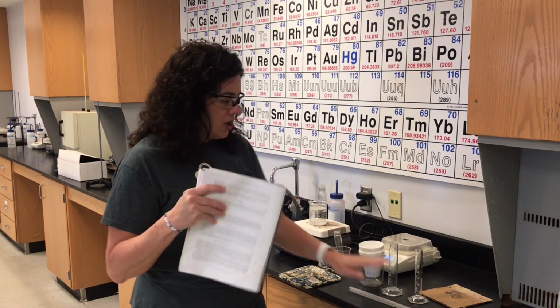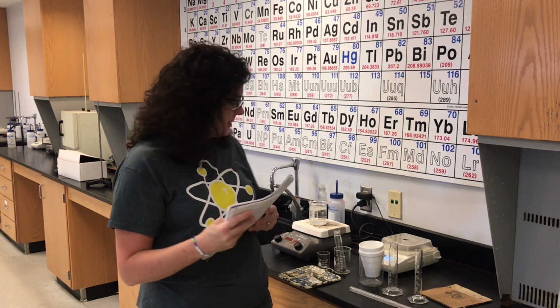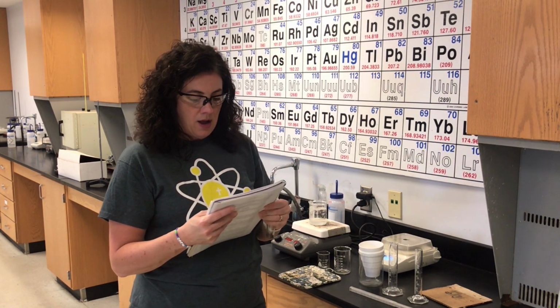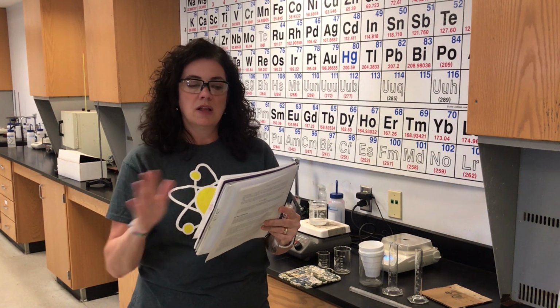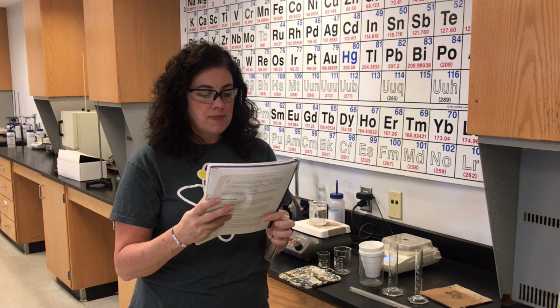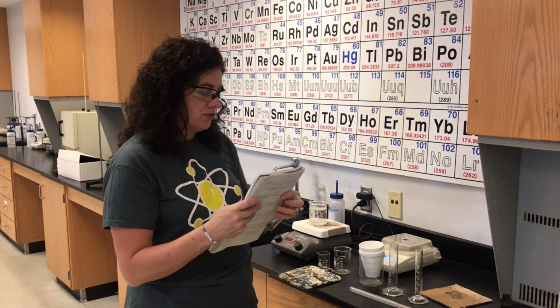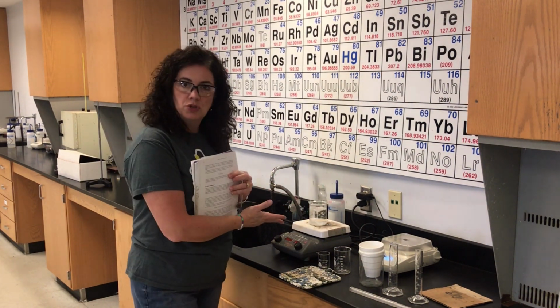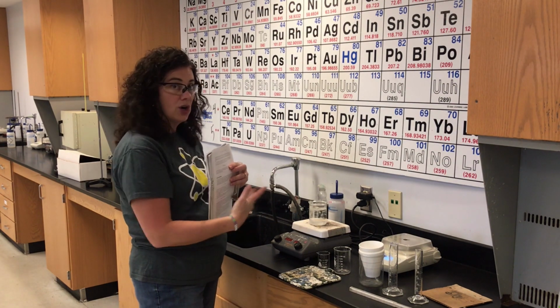So we have that. I have the thermometer and a metal sample in my test tube. It says a sample of unknown solid, but that's for part B, which we're not doing. Then the third paragraph says fill a 400 cubic centimeter beaker. That's another way of saying a 400 milliliter beaker, because a cubic centimeter is the same thing as a milliliter. I just used a 250 ml beaker with water, and that's boiling.